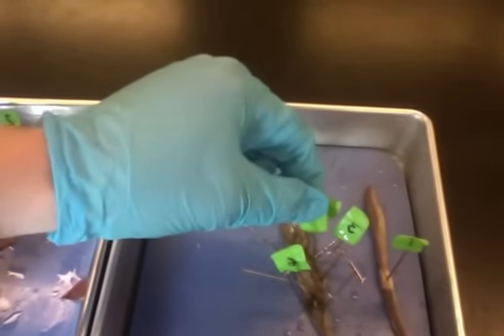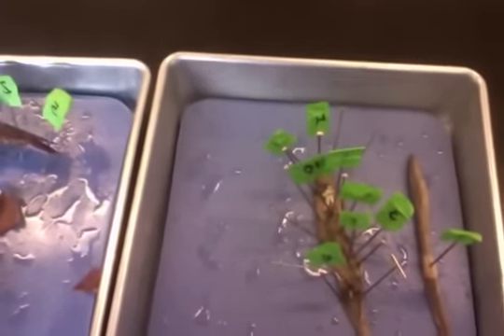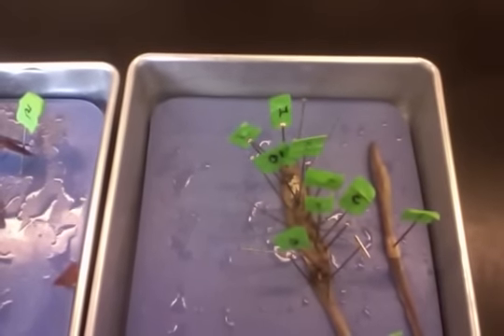6 and 8 right here, this black line on top of the intestine is the dorsal blood vessel, and then of course following that is the intestine. Here are the answers for the earthworm, as you can see. Squid and the crayfish. And that is the lab practical.